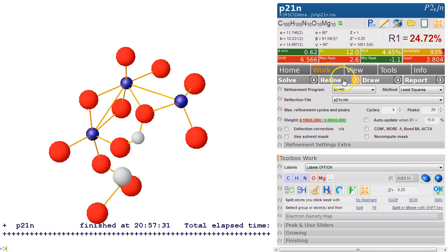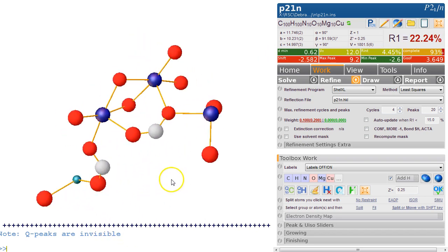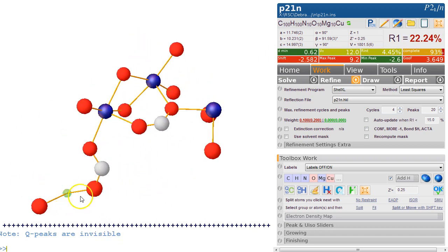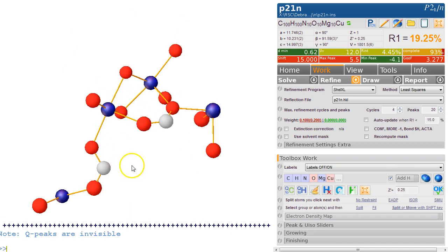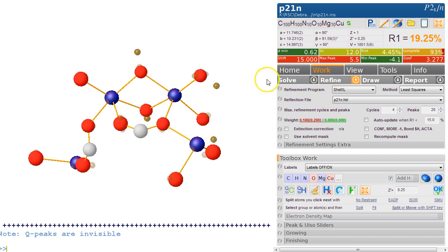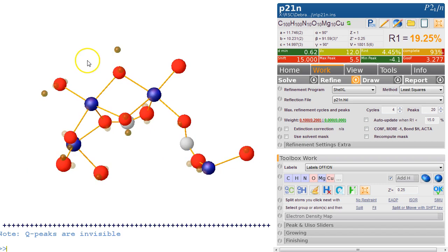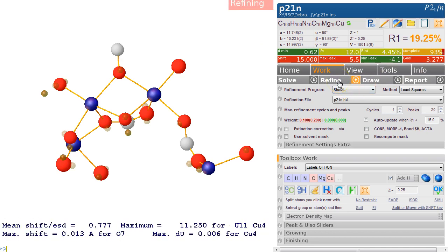The R factor is 24%. And if we refine that, let's see what we get. Oh, that looks a lot better. The R factor, 22%, not great, but things are starting to look a bit better. Now this one we've forgotten, so let's make this a copper as well and refine this. So at least all these spheres are now roughly on the same sort of scale, so that's more promising. Any Q peaks that we haven't looked at, just press Ctrl Q, so that toggles these Q peaks. So the biggest peak is 5.5, so let's make it name C and hit refine again.